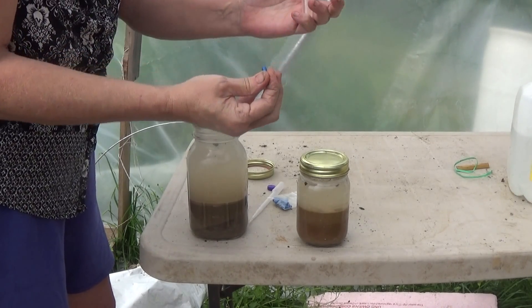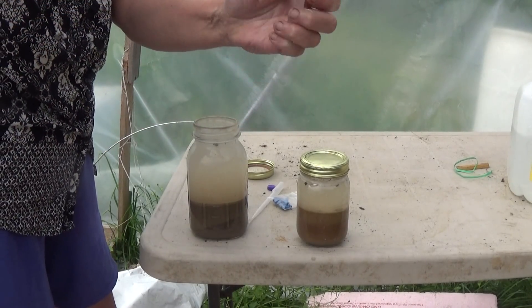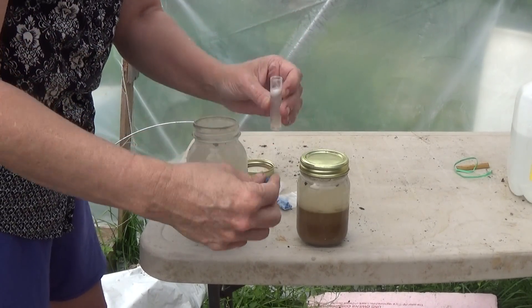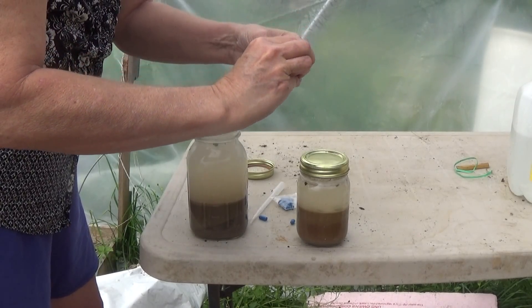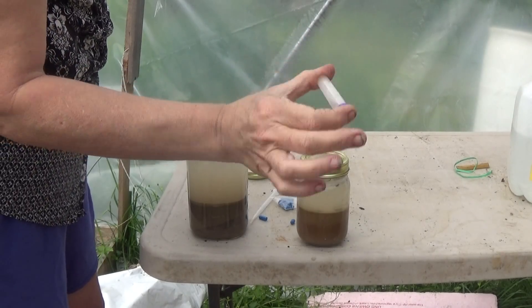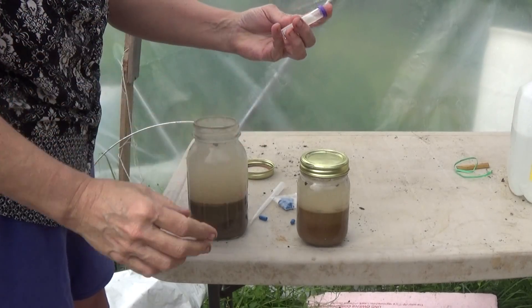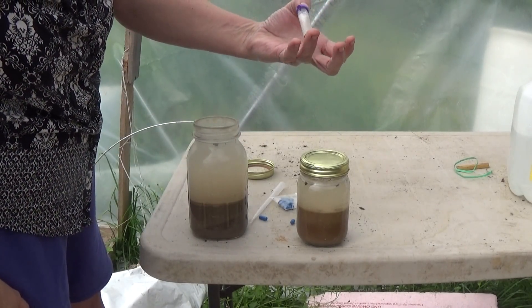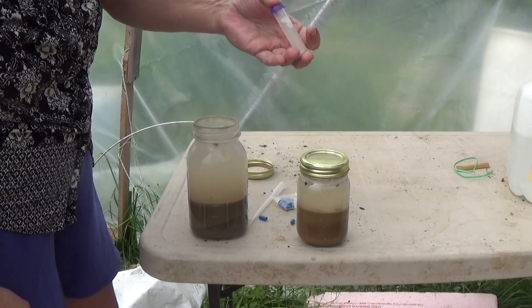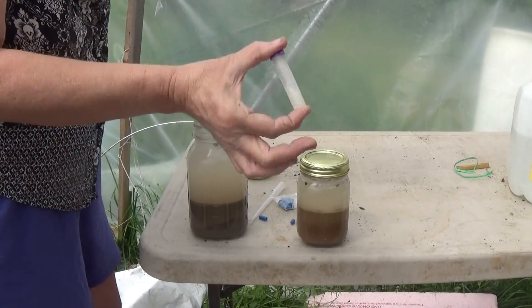All you do is fill the water up to the line, open the capsules, and put them in. Put the lid on, shake it up, and then wait a minute for results. With this settling so long, I've got less dirt in here than I did in my first samples, so I'm hoping something might show up.